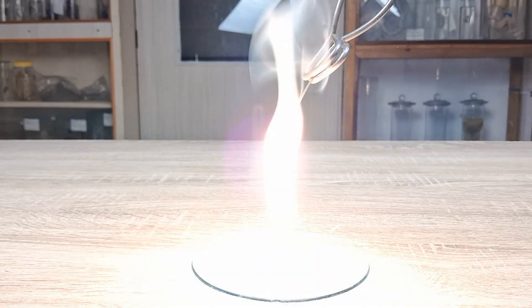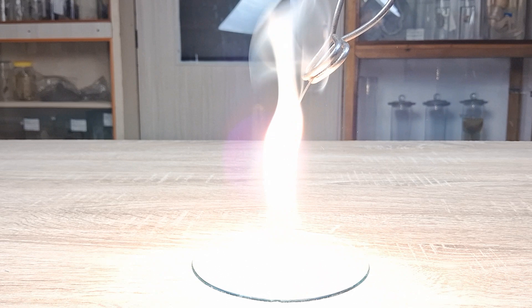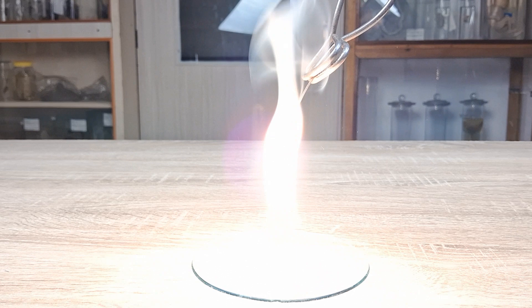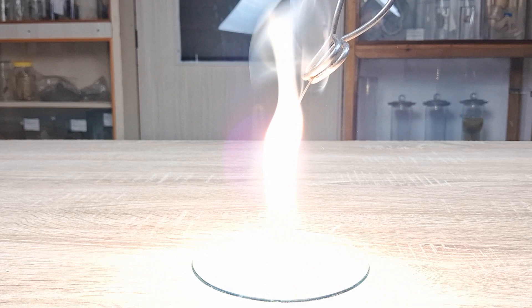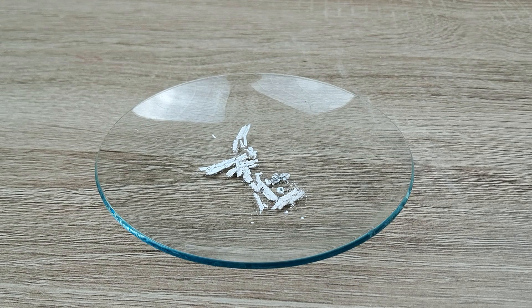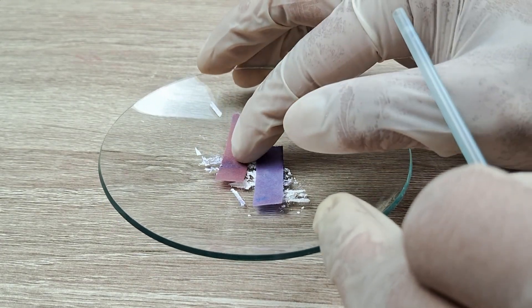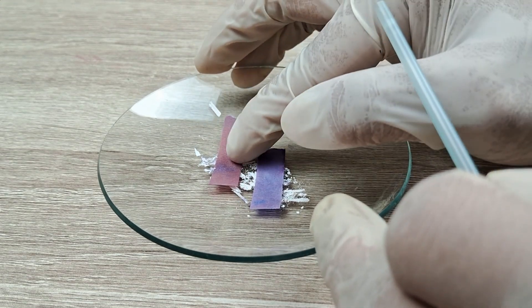When ignited, magnesium ribbon reacts with the oxygen in air and burns with a dazzling white flame. Unlike the reaction of calcium oxide with water, which is spontaneous, the reaction of magnesium with oxygen requires an external energy input in the form of heat — in this case, the flame from the lighter or matchstick. Once all the magnesium ribbon had burned, the combination reaction stops, leaving behind a white residue. The white residue, when tested with litmus paper, turns the red litmus blue, indicating that the residue is basic in nature.